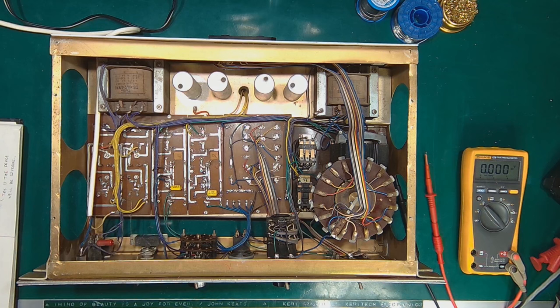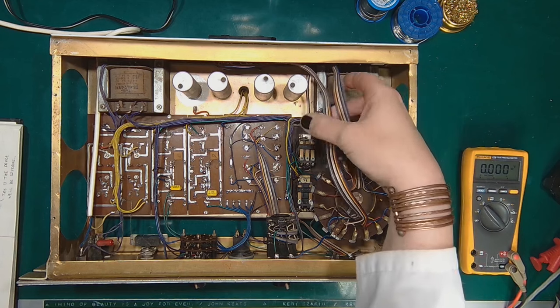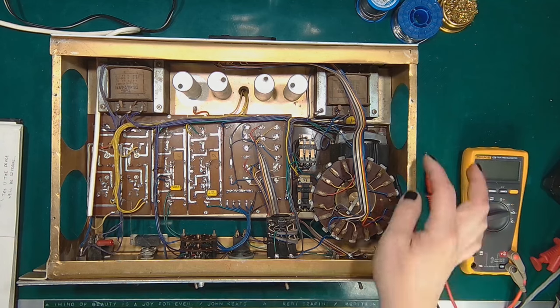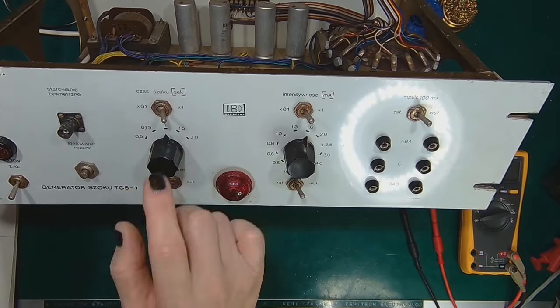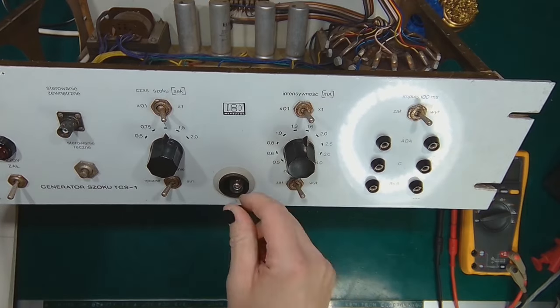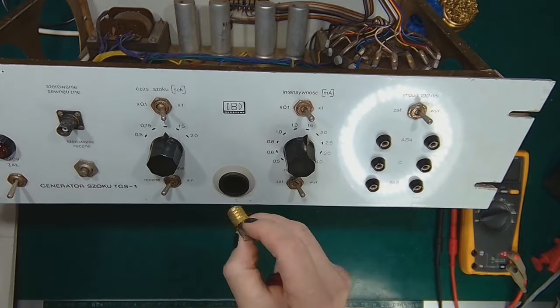So how is this shock generator built? Inside we have two transformers. This transformer is the power supply transformer, and this transformer is for the shock voltage. It has two high voltage windings connected in series. And this is turned on by this relay for a short time period that we choose with this pair of controls, like I demonstrated. The neon light inside indicates that the shock is active. E14 neon bulb, thing of beauty, joy forever.